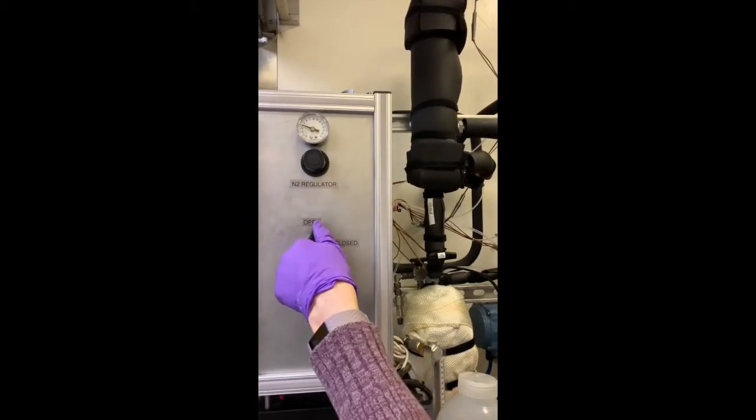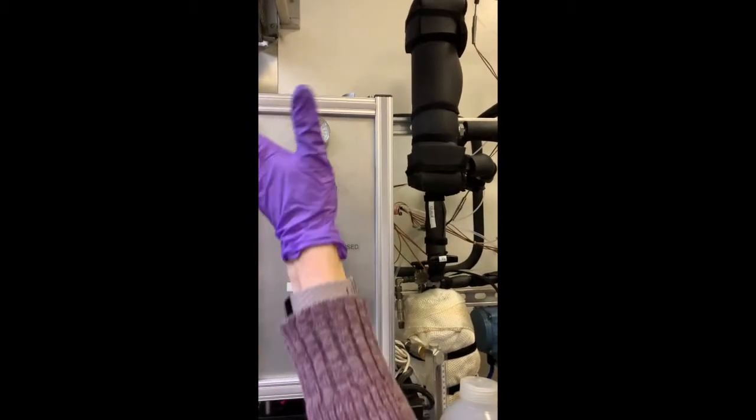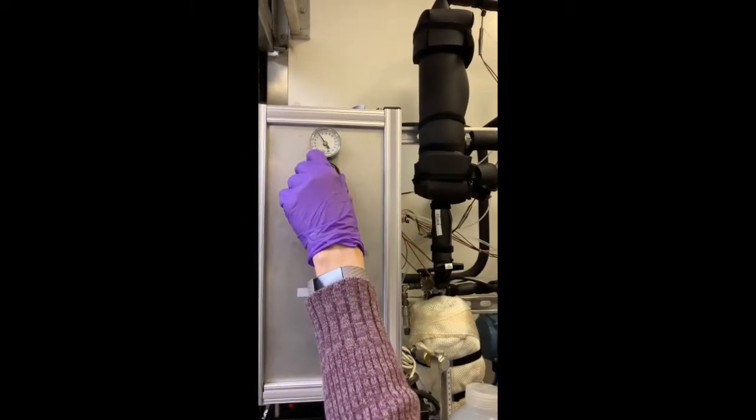After a new module is installed, the system is pressure tested to ensure the module and fittings are leak free.